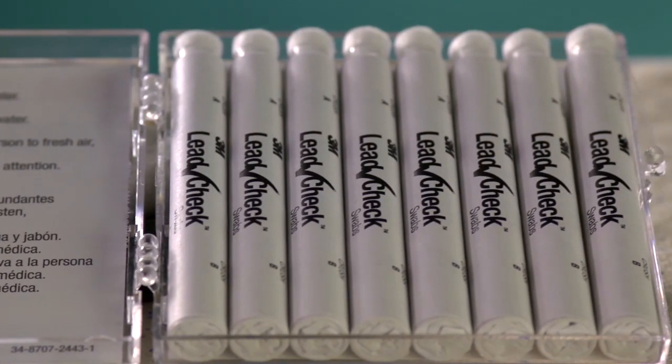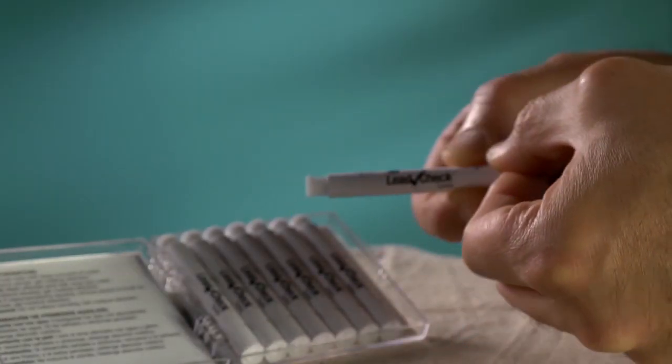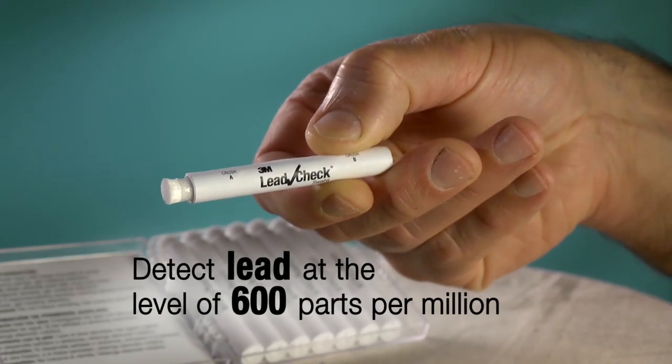For this test, you will need one or more 3M Lead Check swabs. 3M Lead Check swabs can detect lead at the level of 600 parts per million.